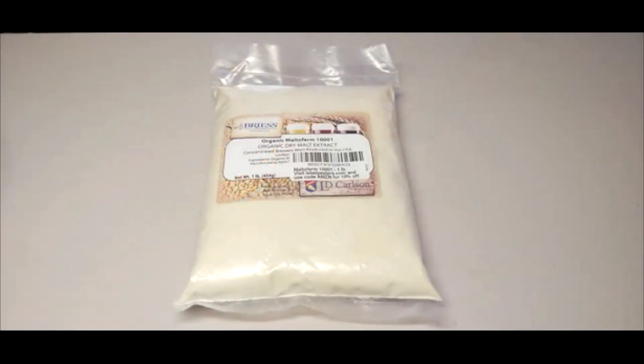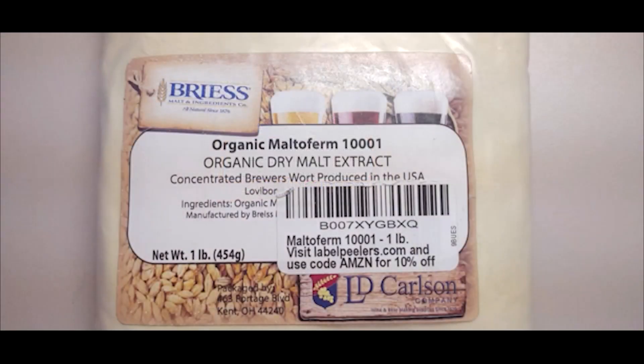There are various malt extracts including light, amber, extra light, pilsen, wheat, rye, and even dark extracts used for brewing various beer styles. All indicators show that any malt extract will work, but light malt extract is preferred in mycology. The malt extract we use in our videos is actually light malt extract.